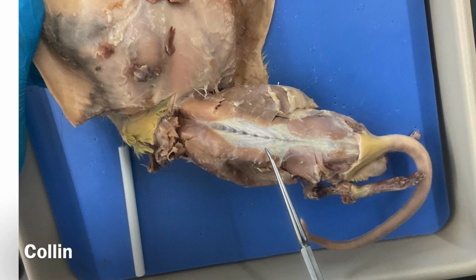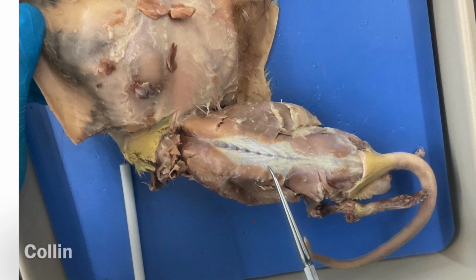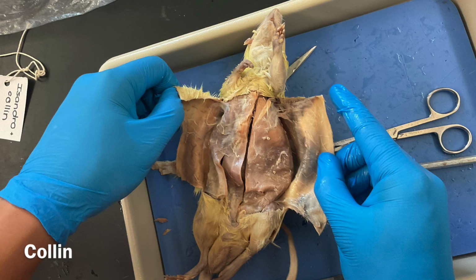This is the skinned rat, showing what the layer below the skin looks like. It is filled with muscle, tissue, and fat.